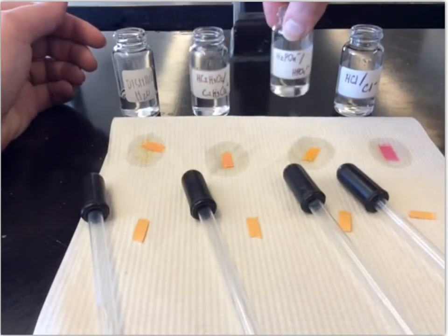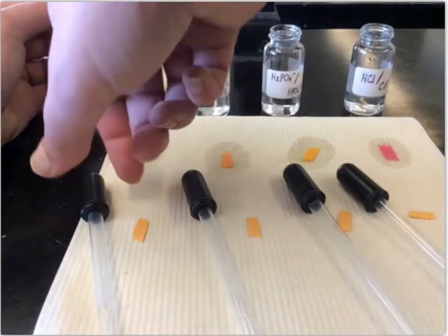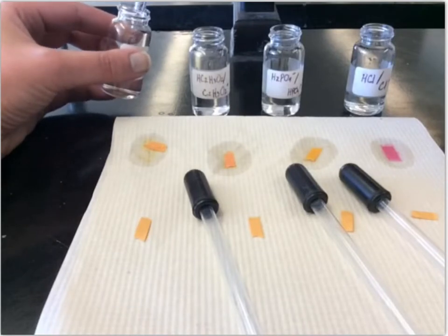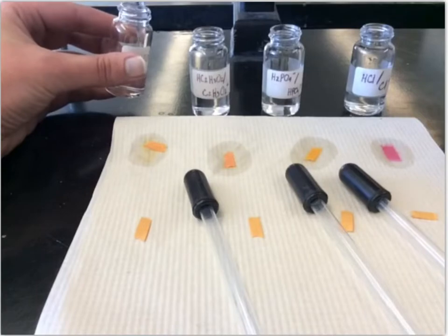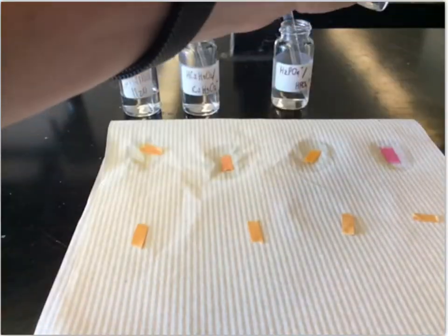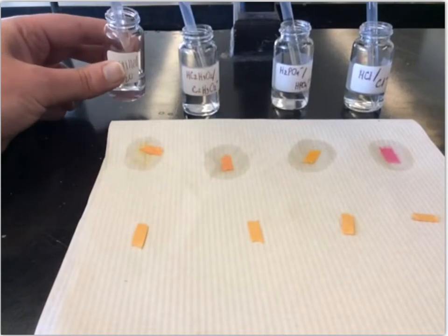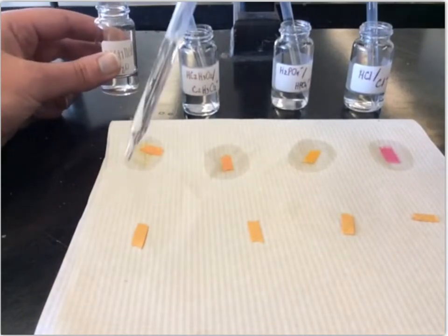I can stir them a bit with the droppers as well, because we're going to measure the pHs of those too. Since there's a little bit of liquid in the dropper, I'll suck some of this up and squirt it out several times to mix it. Okay, so those are all mixed now. So again, we will put a drop of each on the paper.